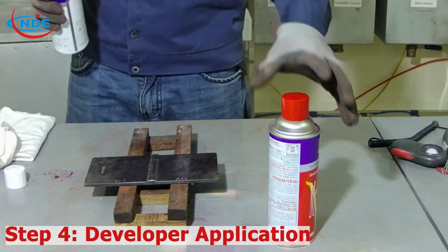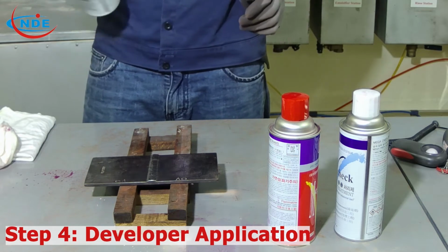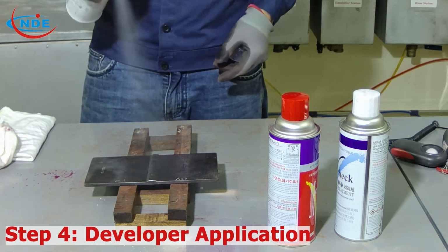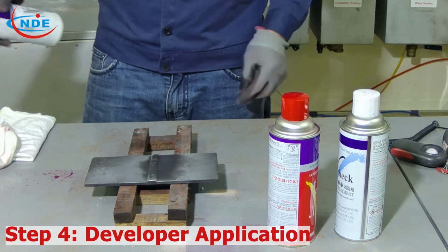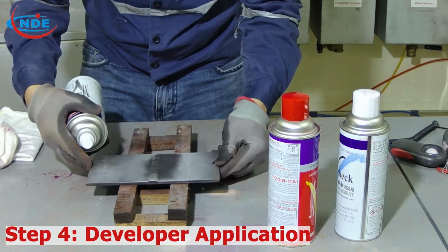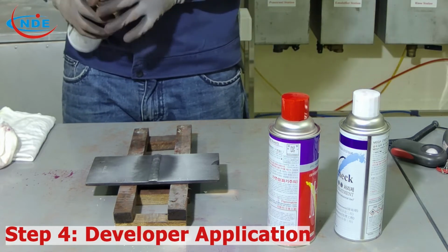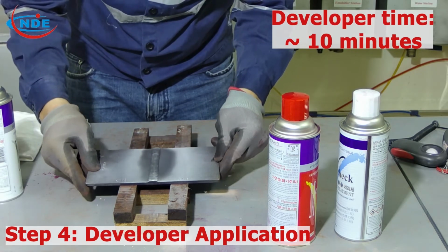Step 4. Developer application. Shake well and spray to form a thin, even and smooth layer of developer. The developing time is about 10 minutes or maybe longer depending on the application procedure. Observe the indications appearing on the surface.